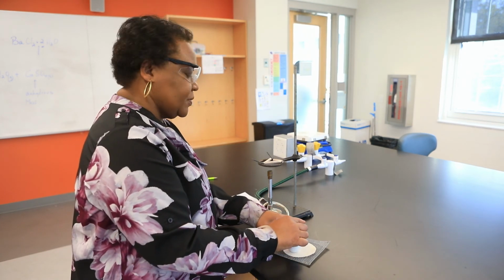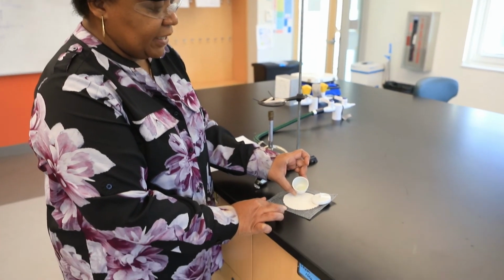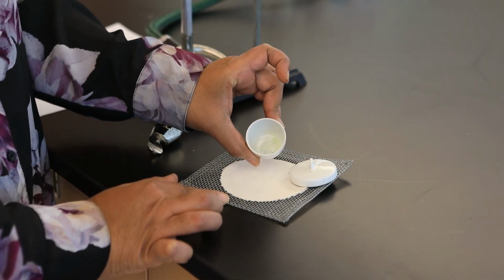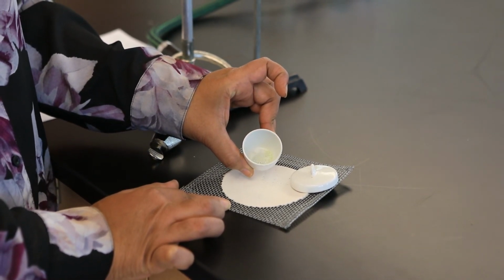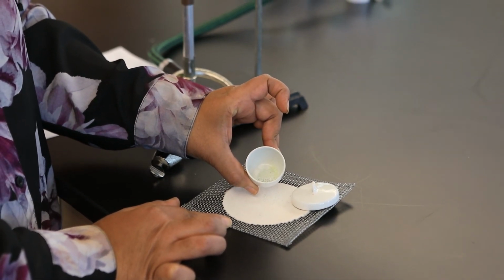So that's the final mass of the crucible and lid with our anhydrous compound. And just to make sure you can observe, we went from that blue crystalline solid of copper(II) sulfate xH2O, the hydrate, to a solid that has a tint of blue but is really a white solid, copper(II) sulfate. And it's void of water, so therefore this is referred to as the anhydrous salt.